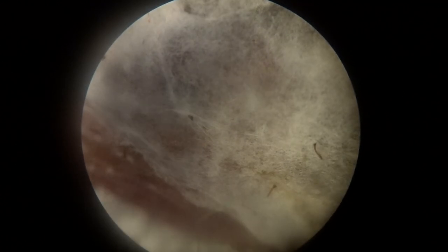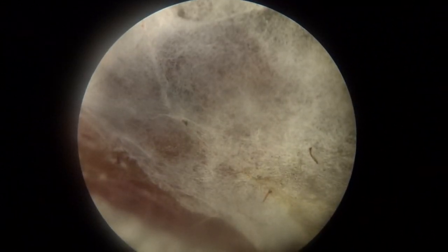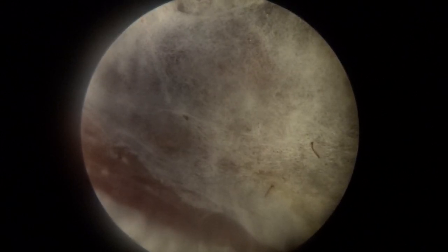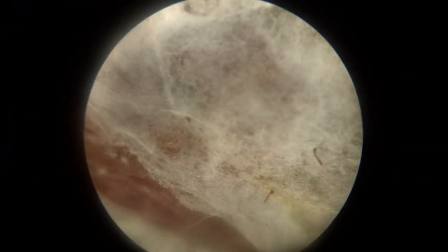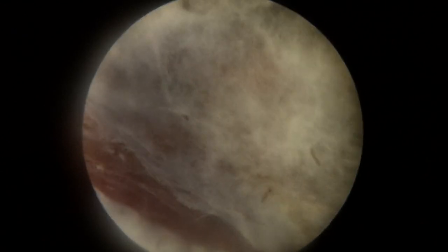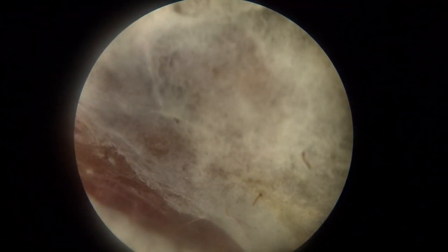Here we can see the mycelium. A fungus is an organism of Kingdom Fungi in Whitaker's classification scheme. There are about 144,000 known species of organisms, which includes mushrooms, molds, yeasts, rusts, mildews, and smuts. Yeasts you can buy at your supermarket — it raises bread when you make homemade bread. Molds are also used in making cheese, such as blue cheese.